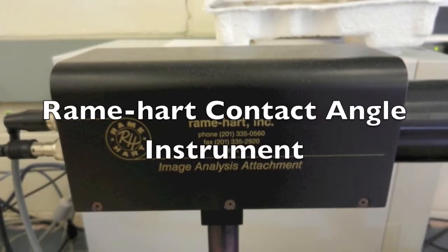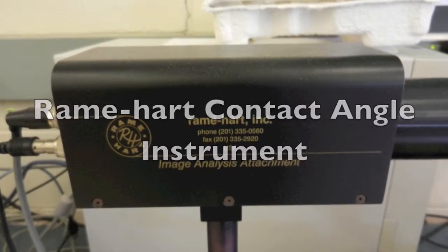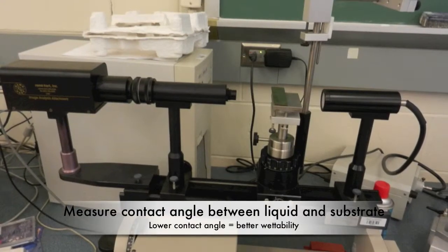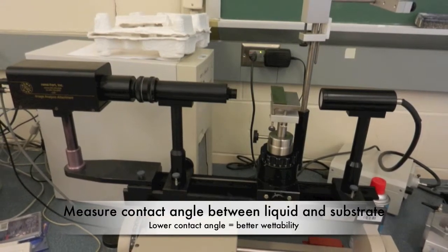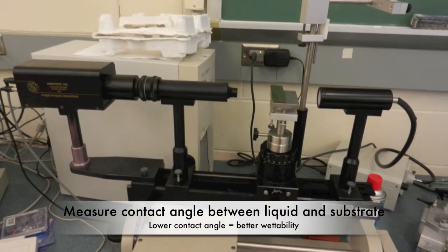The contact angle instrument is used to measure the contact angle of a liquid on a substrate, quantifying the wettability between the two components. The lower the contact angle, the better the wettability is.